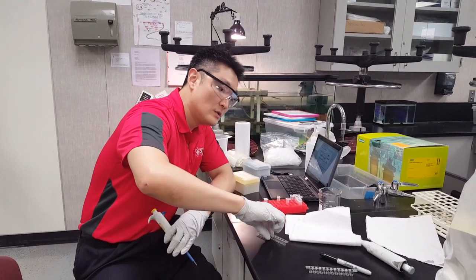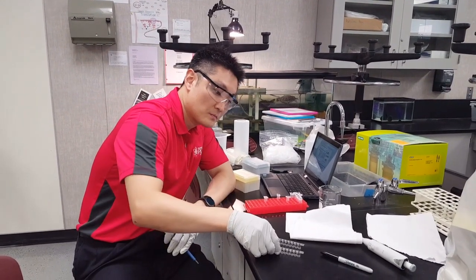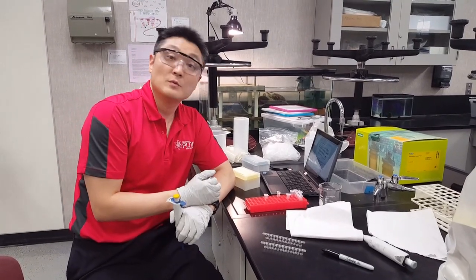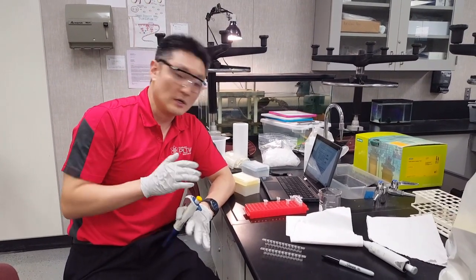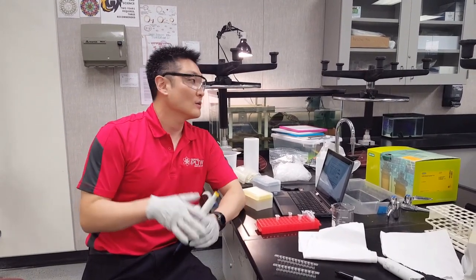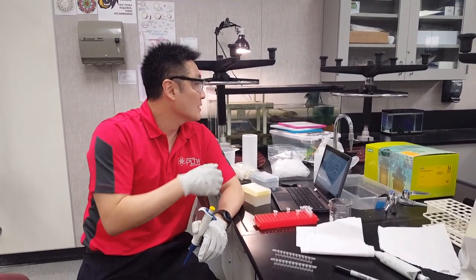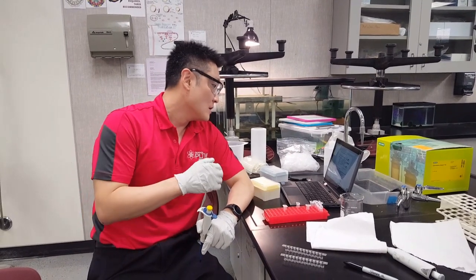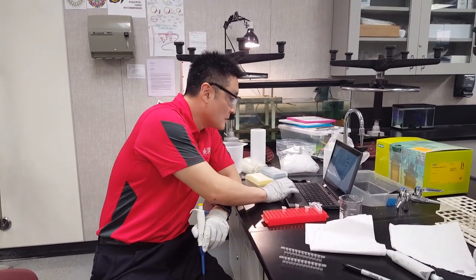Now incubate both strips for 5 minutes at room temperature. Set your timer and relax — go look at the turtles or leopard geckos for 5 minutes — then come back.